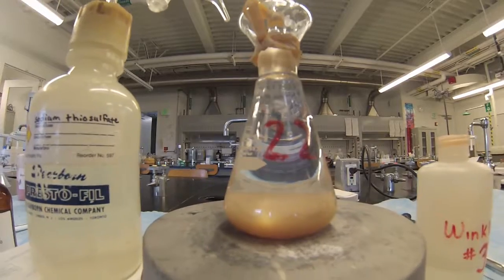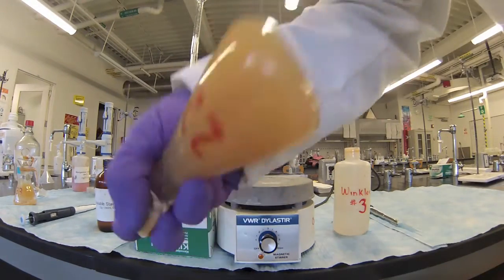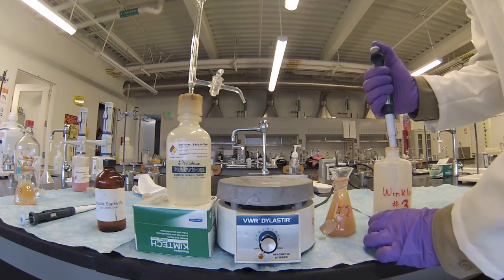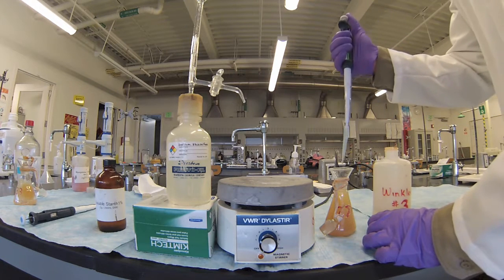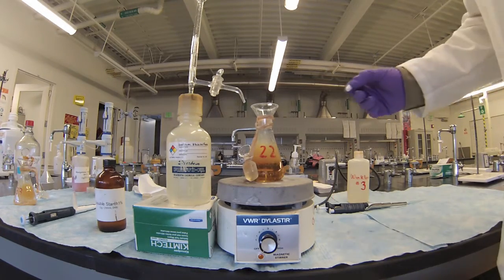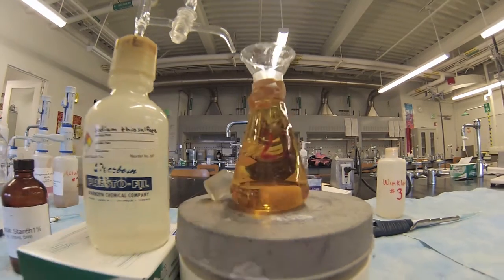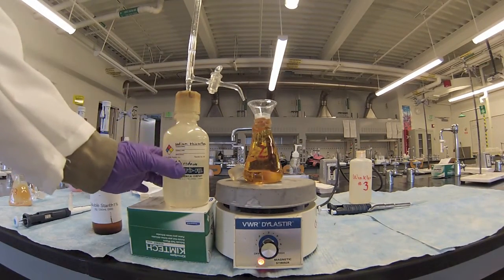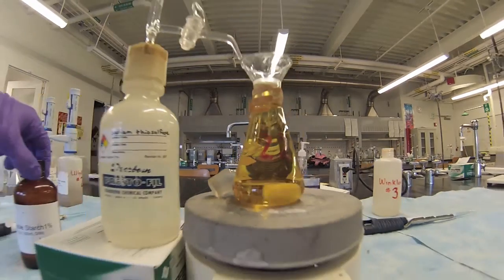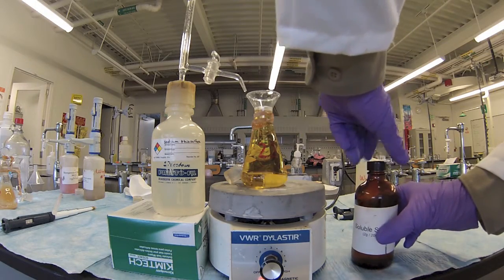Now that the sample is fixed and has sat at least 30 minutes, we are ready to titrate. Shake the bottle well so the precipitate mixes into the sample. Add one milliliter of Winkler-3 to your sample and stir well. If the precipitate does not fully dissolve, add another milliliter of Winkler-3. Now titrate the sample with sodium thiosulfate until the solution becomes a faint yellow. During the fixing process, reagents react with the dissolved oxygen in the sample to form manganic hydroxide, then iodine. The iodine in the sample is directly equivalent to the amount of dissolved oxygen, and we are actually titrating for the iodine rather than oxygen.